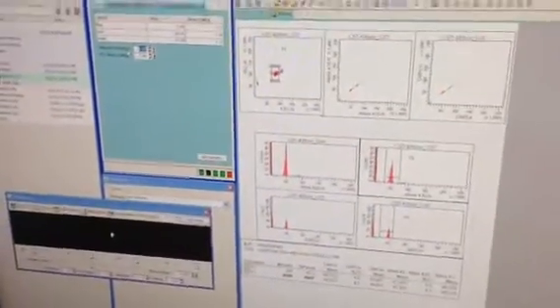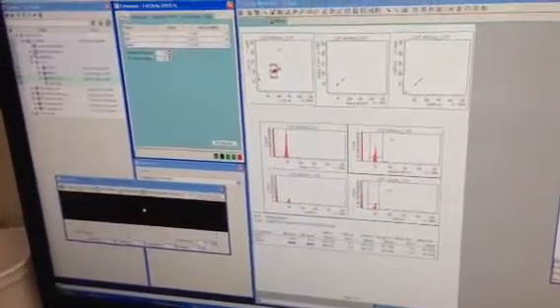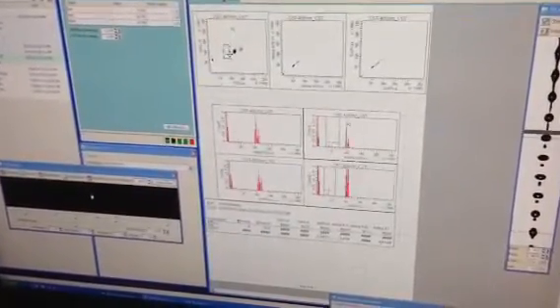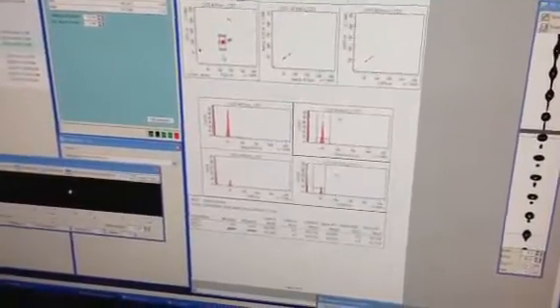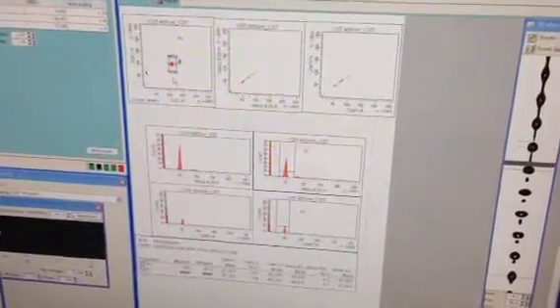What else can I say about that? I don't think there's really much else. The same thing happens on the red laser. The red and violet laser are essentially the same process. So do you do that for all of them? Yes, you would, actually. I didn't show that earlier, but you would definitely want to set window extension to zero when you're doing anything to adjust your laser delay.